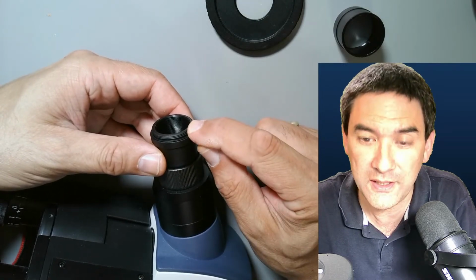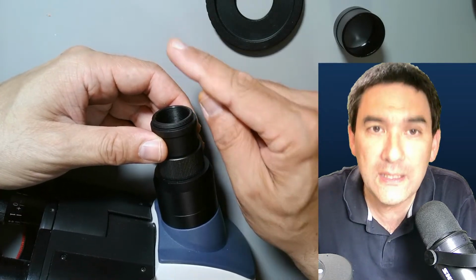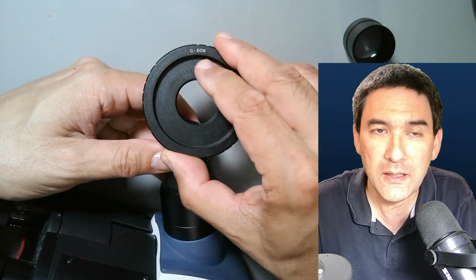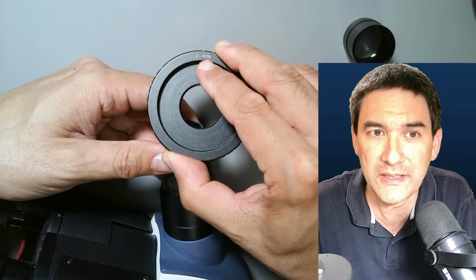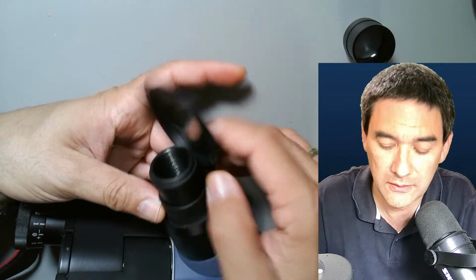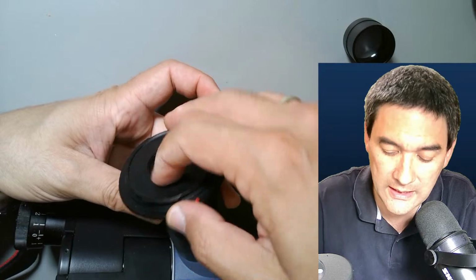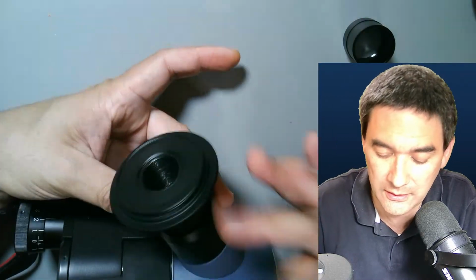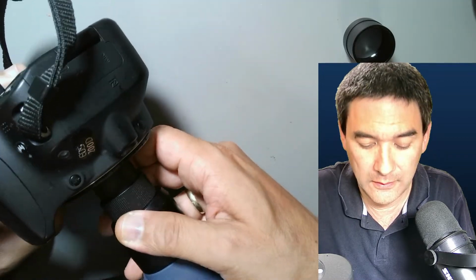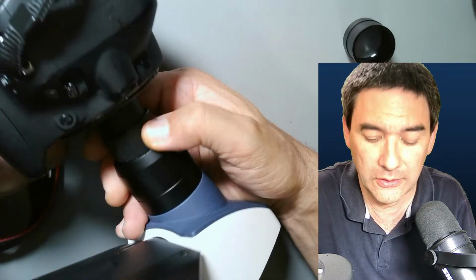Okay, without intermediate optics. So basically the image is created by the objective of the microscope and is directly projected into the sensor. Yes, and so the distance has to be a little bit smaller. And what I have here is a C-mount to Canon EOS adapter, and you see that basically this one here will screw in place here. Now I cannot show you the camera view here. And then the camera goes directly on top here. I will also show you how this works. It goes directly on top here. It locks into place just like a regular lens. And then that's it. Okay?